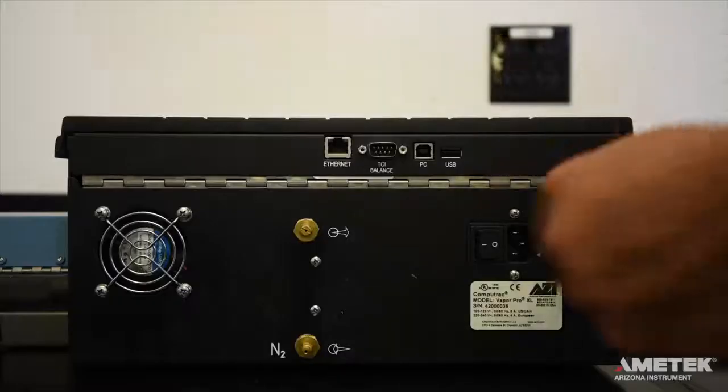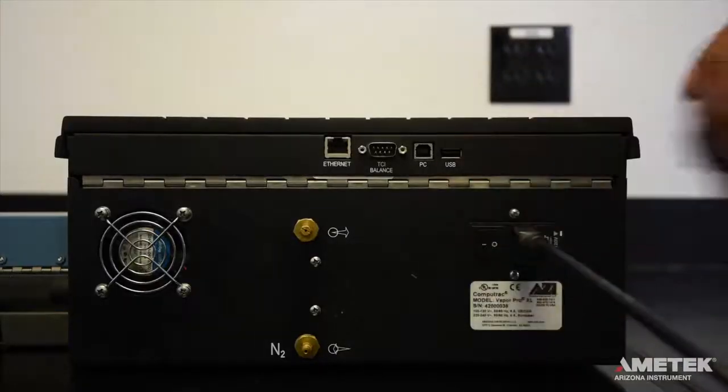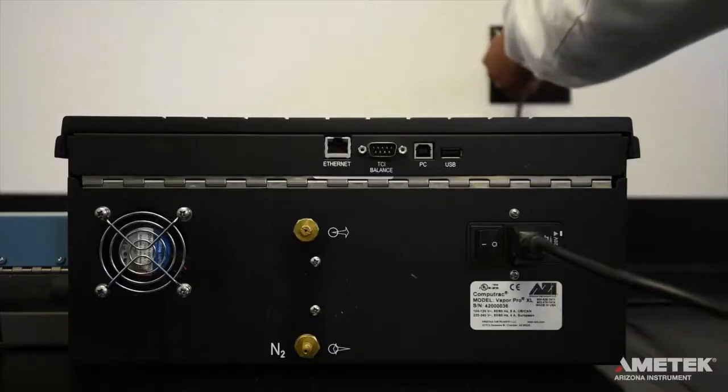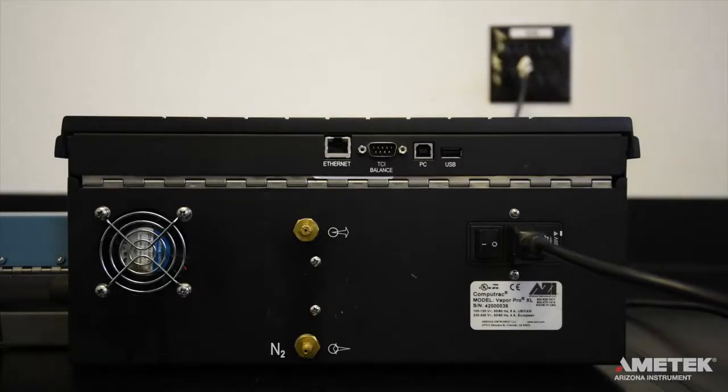Insert the rectangular end of the included power cord firmly into the matching port on the back of the instrument and plug the other end into an isolated power outlet with dedicated electrical power, but don't turn the instrument on yet.